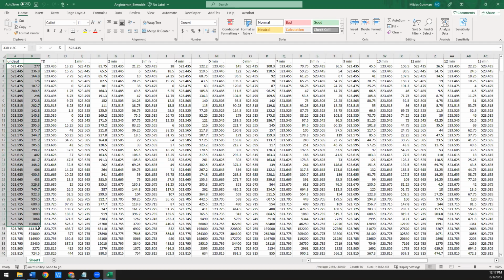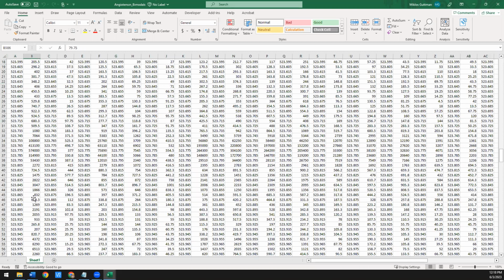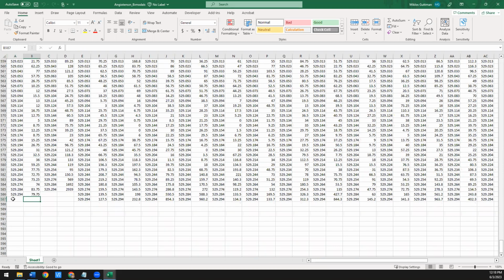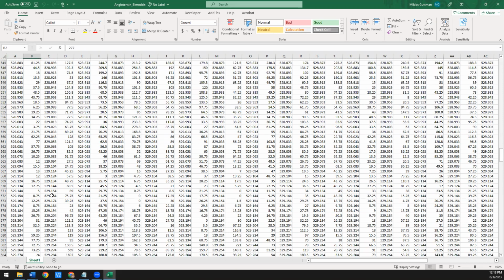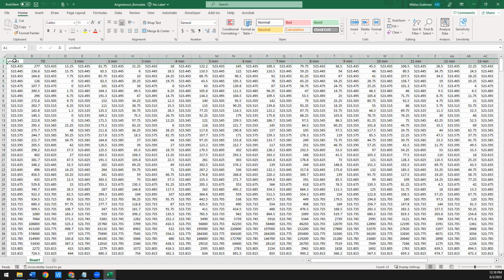Whenever you prepare data to process in HXExpress, you have to make sure that you don't have duplicate entries of the M over Z value. Sometimes when you export spectra from certain softwares, you won't have enough decimal places, and a lot of these entries will be duplicates. So if that's the case, go back, change how you export the data to fix that. You also don't want to have any blank rows. Lastly, sometimes I've noticed from Thermo data, it puts in some weird text at the very end, depending on how you export the spectra. You don't want to have any of that. So if it adds any text to the end, you'll also want to trim that off. Otherwise, it's going to lead to errors. Lastly, the labels at the top for your time points.